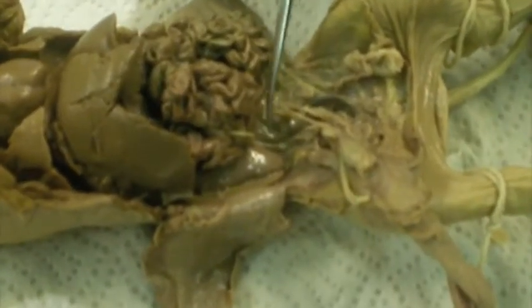So over here is the rectum, where the waste is stored, and it's taken out and it's released through the anus over here. So the kidneys are over here and over here, and the function is it's a filtering organ that produces urine and also regulates water content, maintains blood pH, conserves amino acids, ions, and sugars that the body needs.